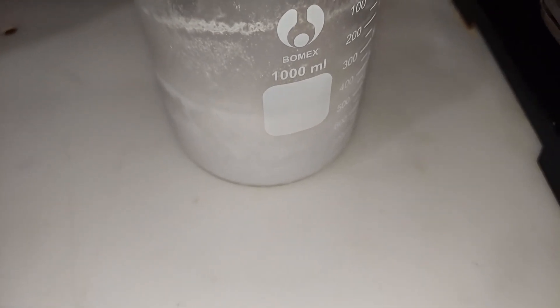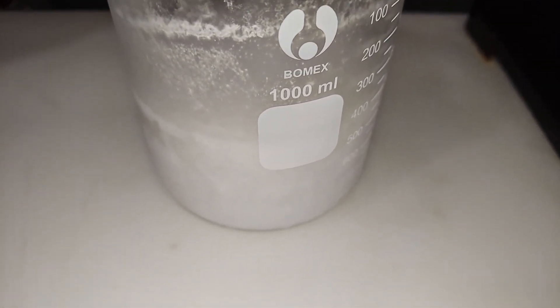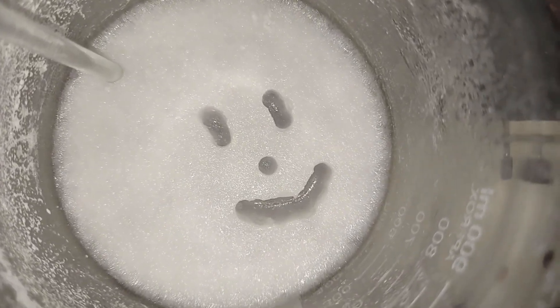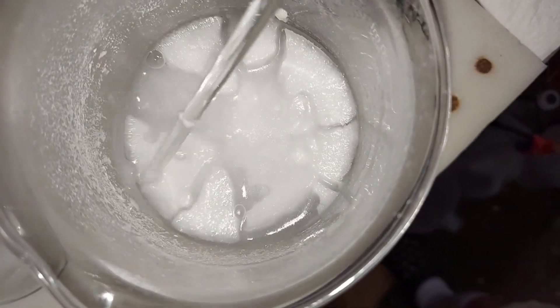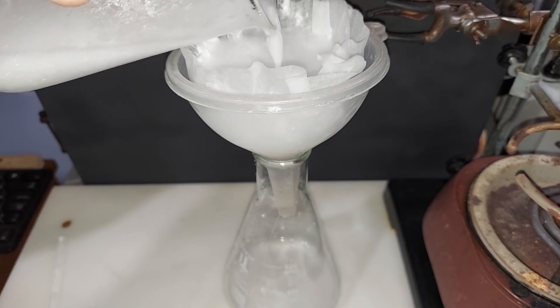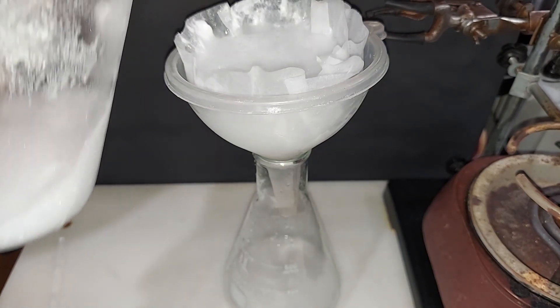I put this in the fridge for a couple hours and you can see all of the salicylic acid packed in there — partly because we lost a lot of water trying to boil it. It's just really tightly packed in there. It just needs to be broken up and filtered. I'm breaking the salicylic acid up — it feels a little bit like styrofoam — and there's quite a bit of liquid still in here. I've double filter-papered the funnel because it's a pretty fine particle.